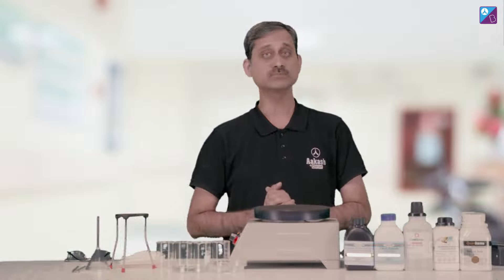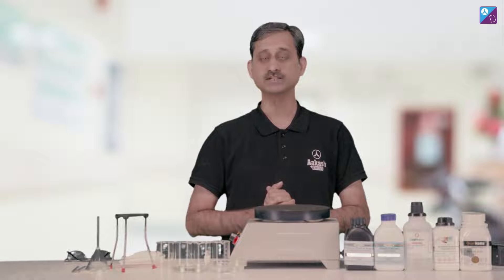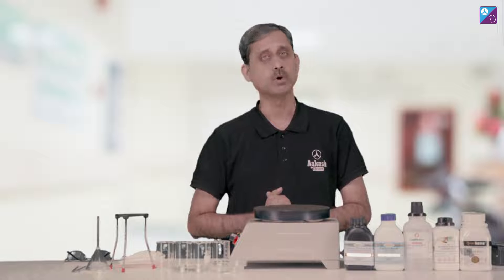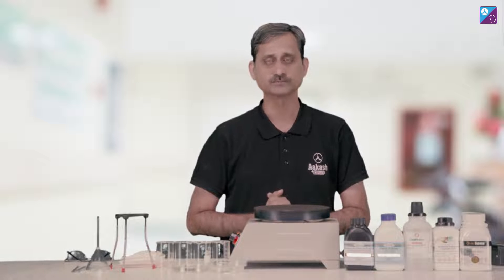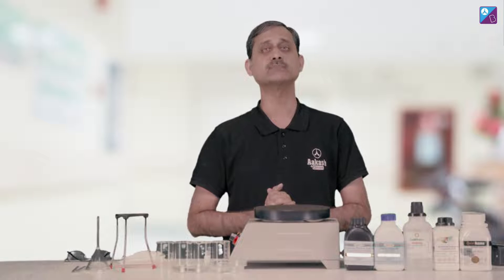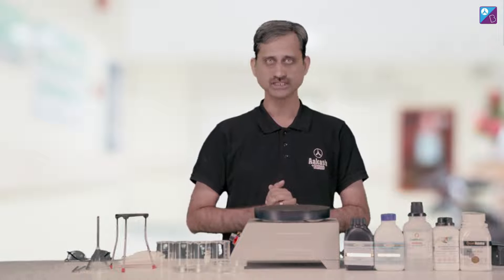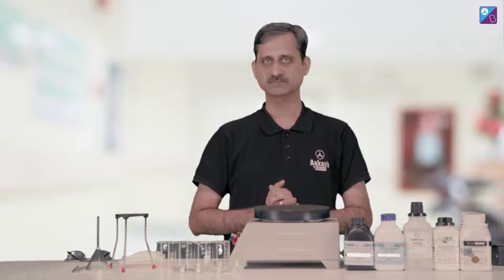Hello, today we are going to do a very important experiment for 11th and 12th class students, and that is crystallization. So let's start our experiment.